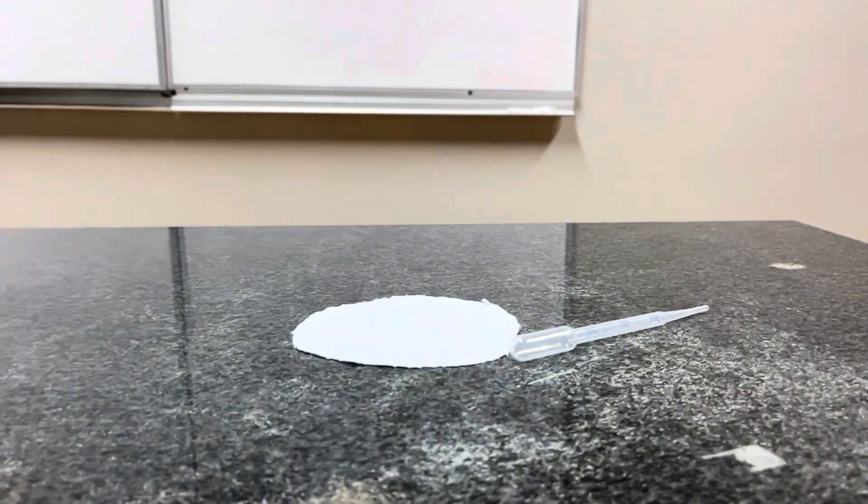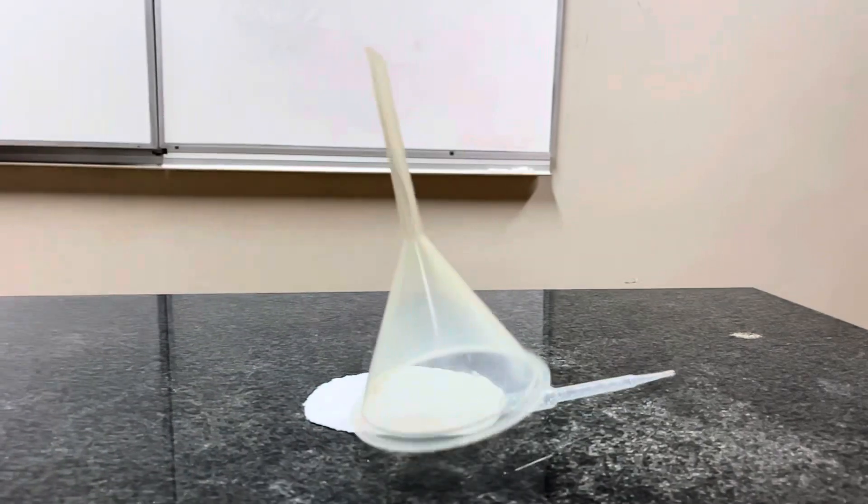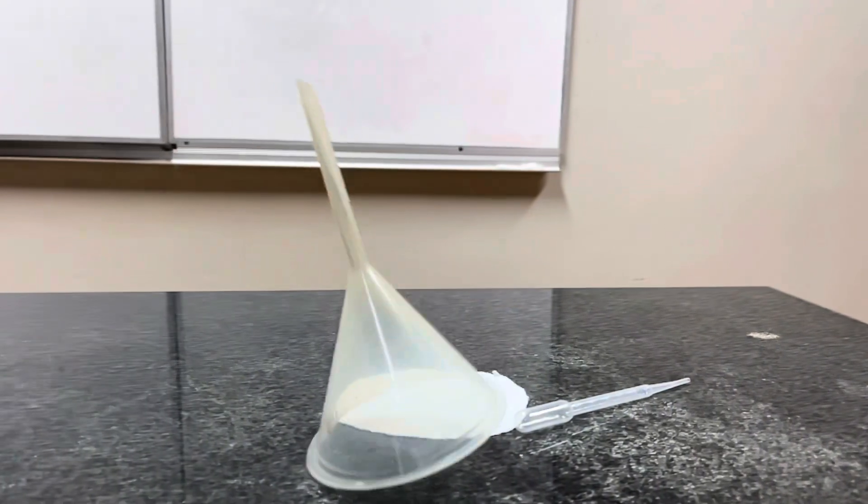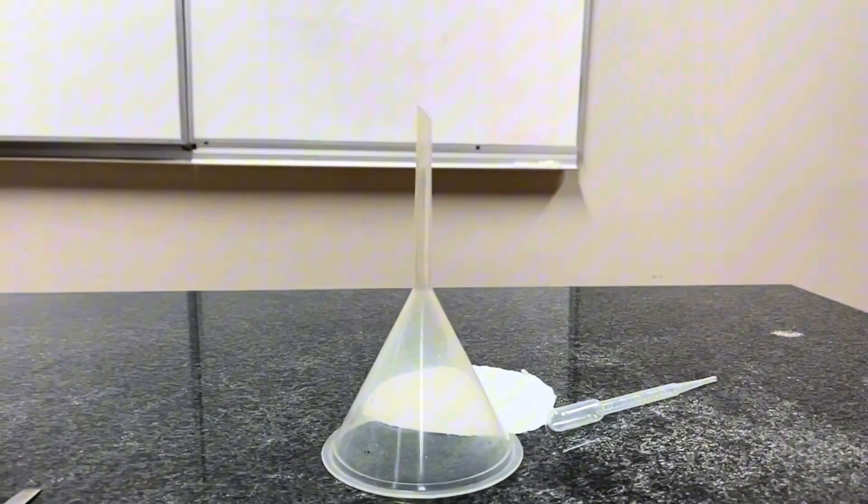We have filter paper, pipette, funnel, glass, glass rod, beaker, and others.